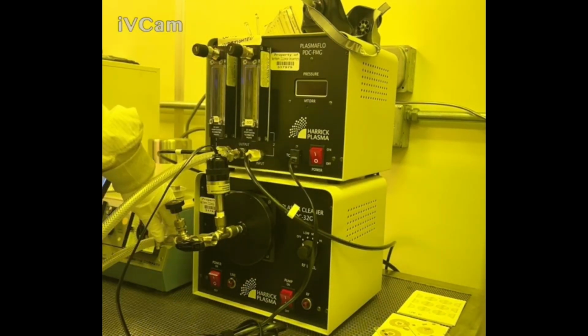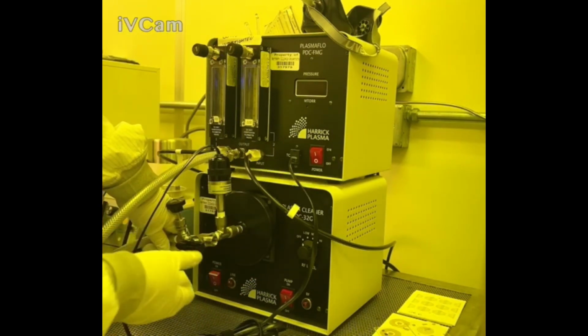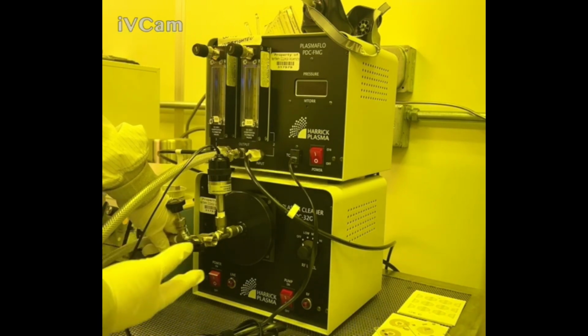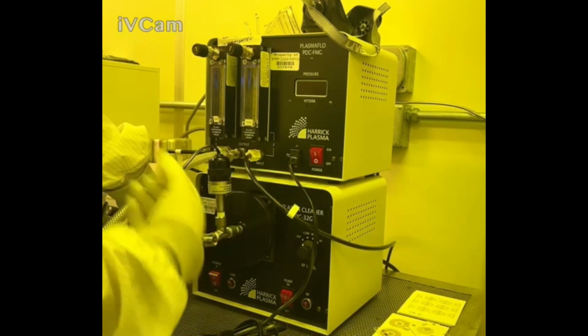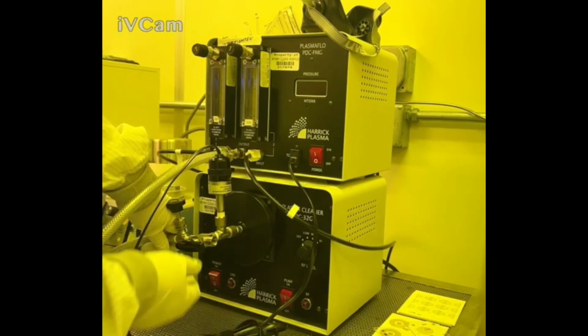So the vacuum is still pulling the lid of the chamber. You don't want to open this up right away, because what's going to happen is if you have a silicon wafer or an untaped material in that chamber, it's going to shoot it and pull it to the back. And depending on how sensitive or how fragile your material is, it could be completely destroyed.